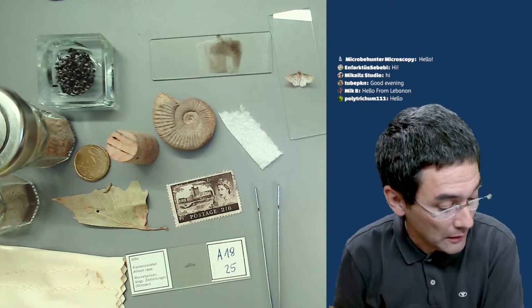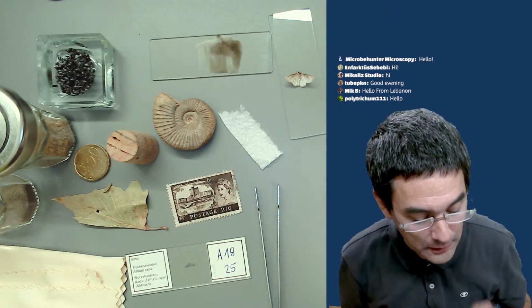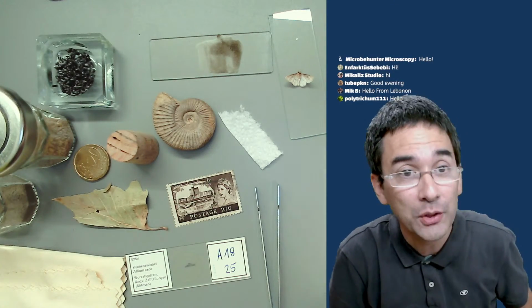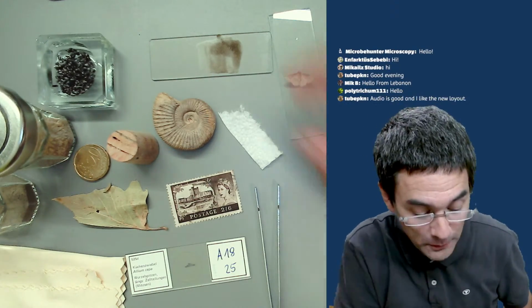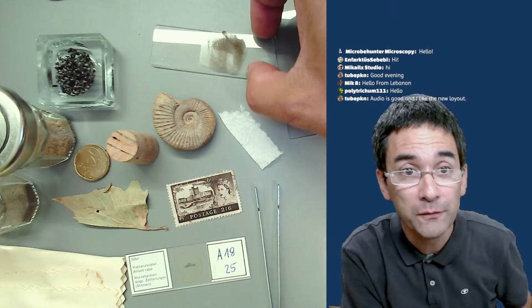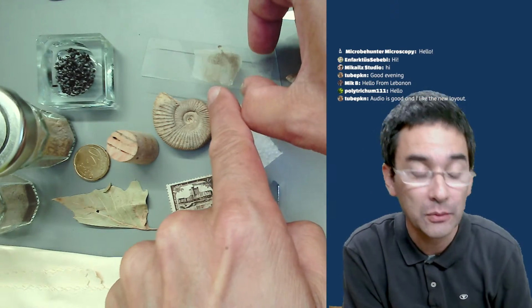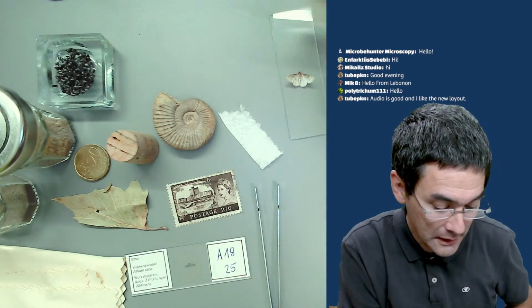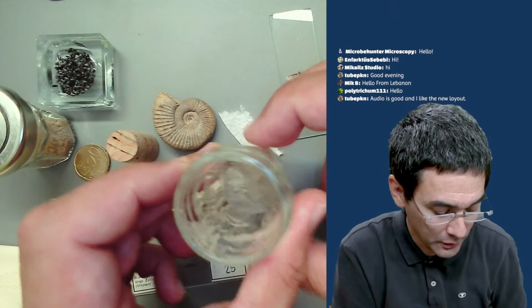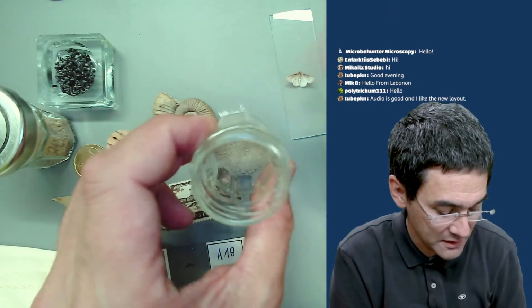So what we're going to do first is the following. I want to do a little bit of lab work. Before I put them under the microscope, the first thing I want to do is put some sand under the microscope, and I have a slide here with sand on the surface. I'm going to show you how I made this slide. It's actually quite simple. I have some sand here. This is from the North Sea, from Germany, which I visited last month.